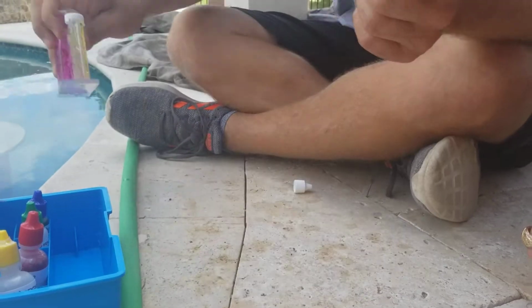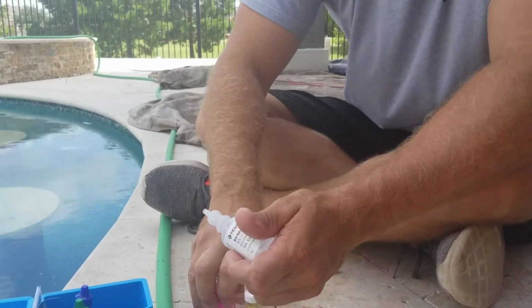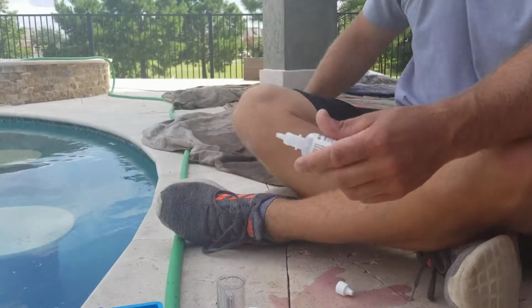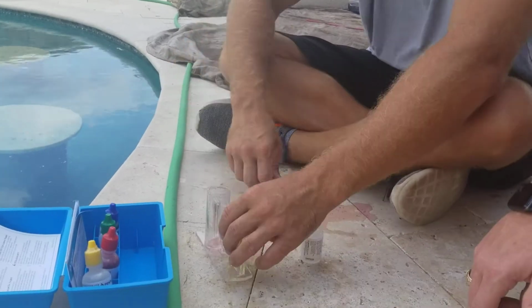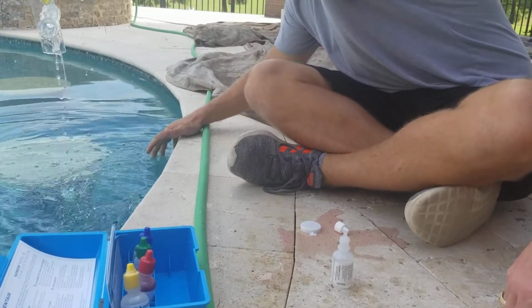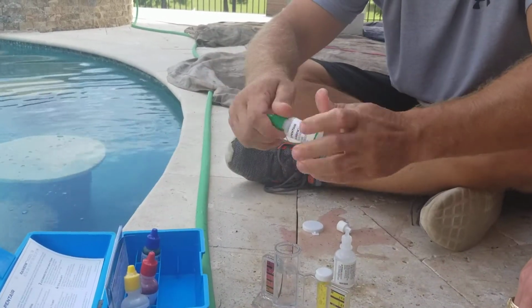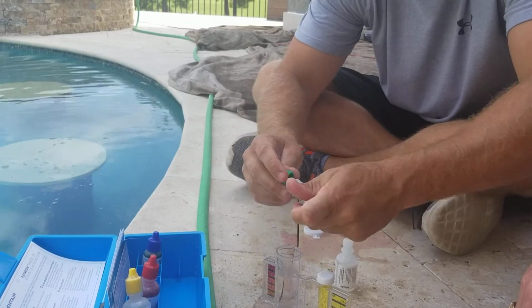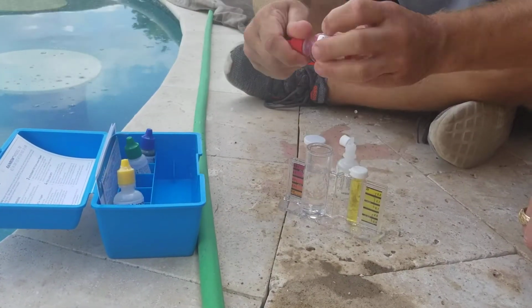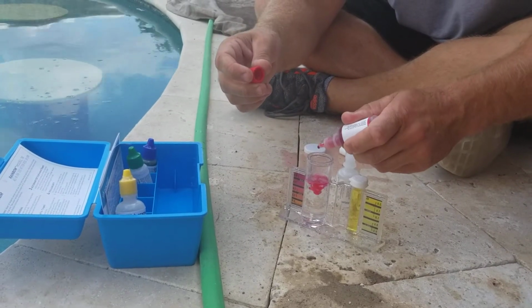1, 2, 3, 4. Oh, start over. Oh man, I felt like it was about to change too. Man. Start over. It's all good. 1, 2. Yeah, once you get the hang of the chemicals, though, I mean, it's pretty easy. 1, 2, 3, 4, 5.